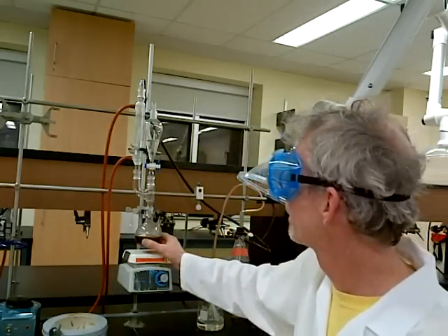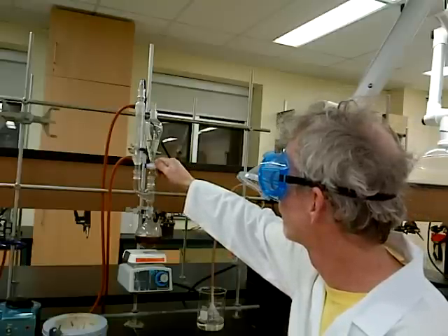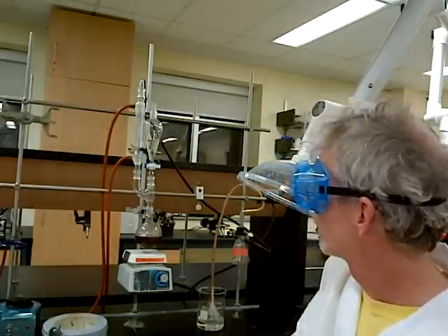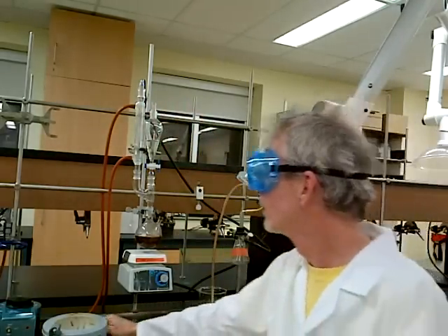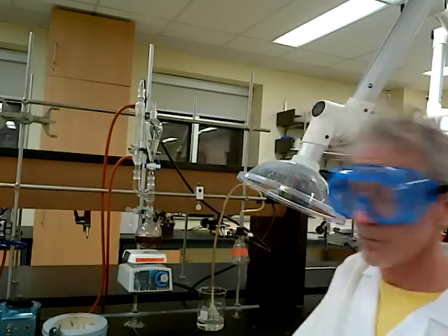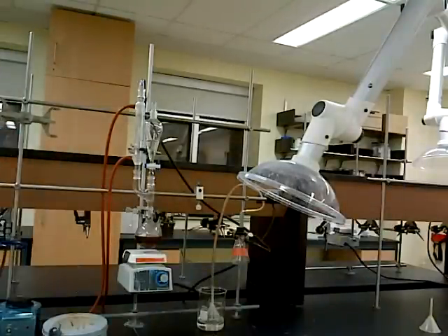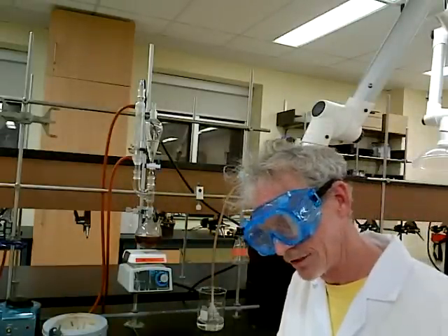I don't have too much heat here yet. Stirring is still good. I don't see any vapors happening. There is no leakage in the system. Cooling water is still flowing. Now would be a good time to write in your lab book or read ahead. When this reaction is finished, we have to separate the organic product from the aqueous layer.